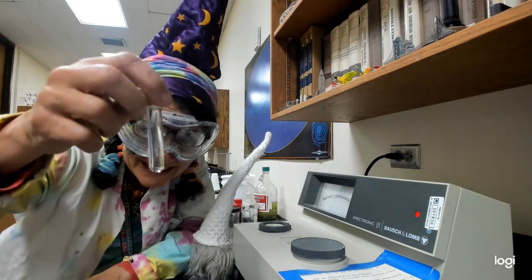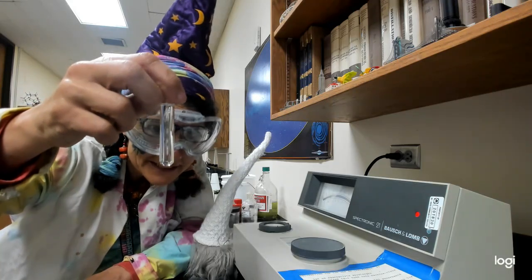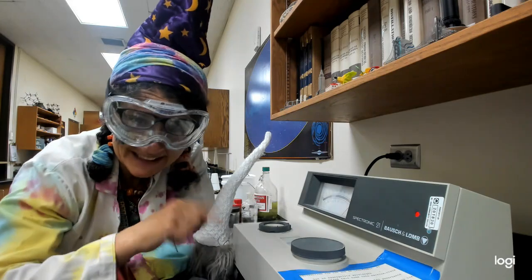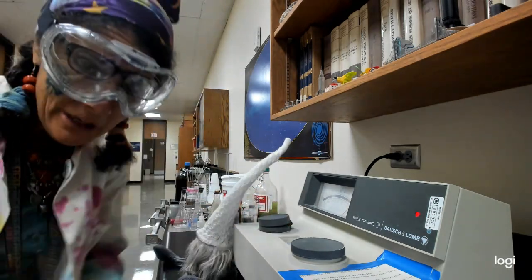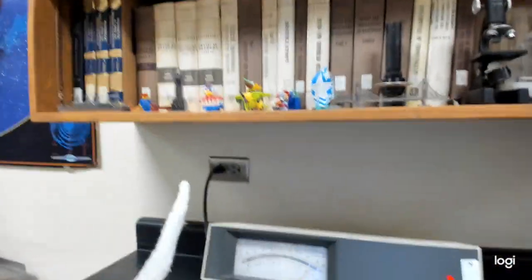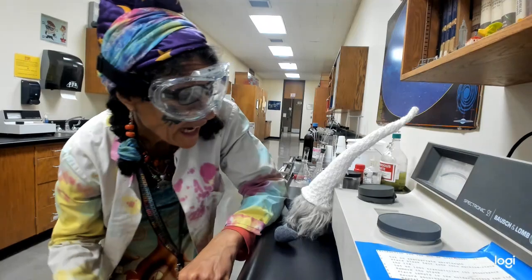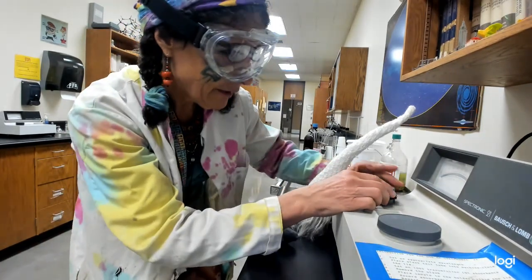Anyway, I'm really excited because this is supposed to be very clear, and it's looking very clear. So I zeroed it already with water. I'm putting it in. Oh my goodness, we did pretty good. It's way down. It hardly absorbed anything at all. 0.035. I zeroed another spectrophotometer just to check. Should we see if we get the same answer?